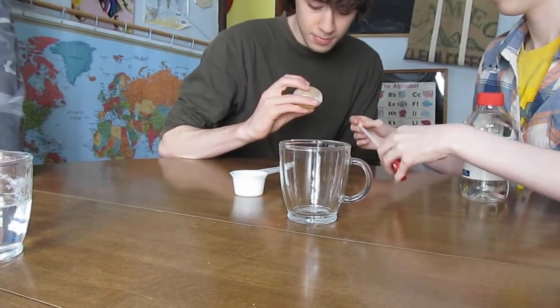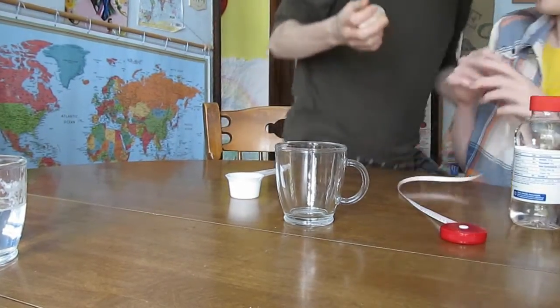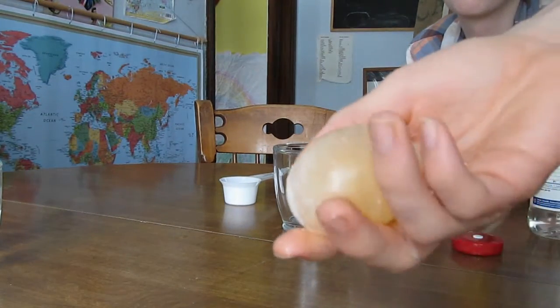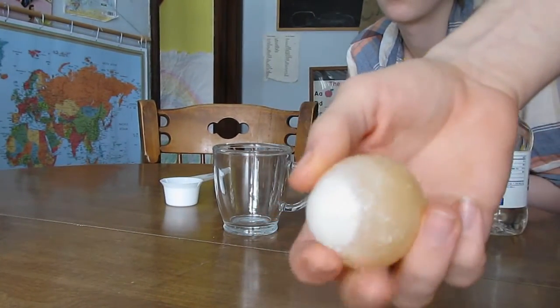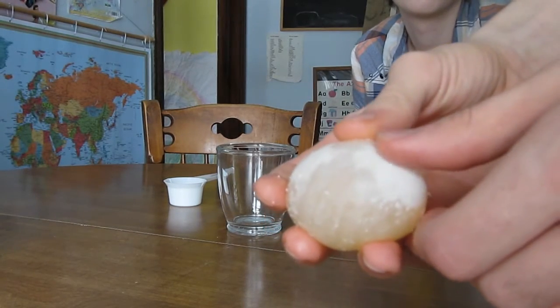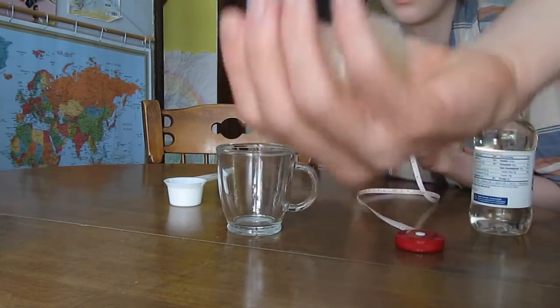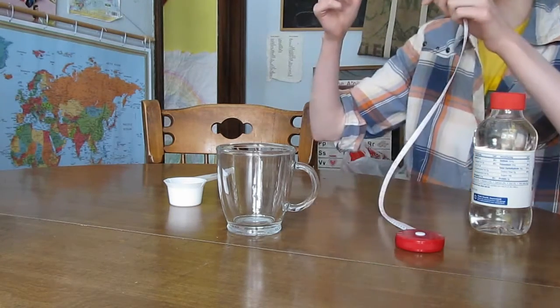Okay, what's the next step? Wait, bring the egg over this way a little more. Let's have a look. Show me the egg. Yep, it's squishy. In fact, we probably could have wiped that stuff off a little bit better, but yeah, so that's an egg without a shell. Now we have to measure it.